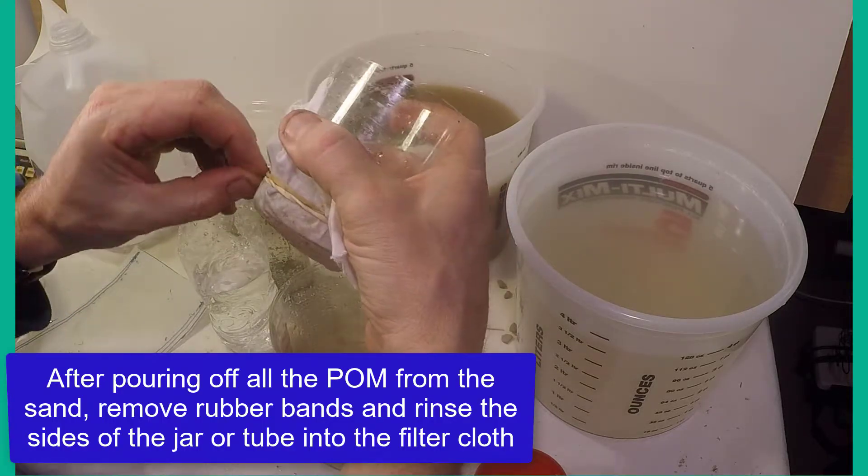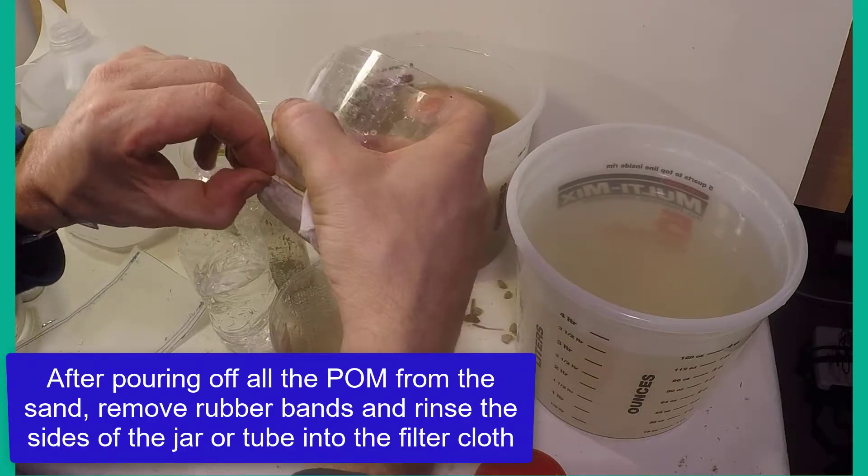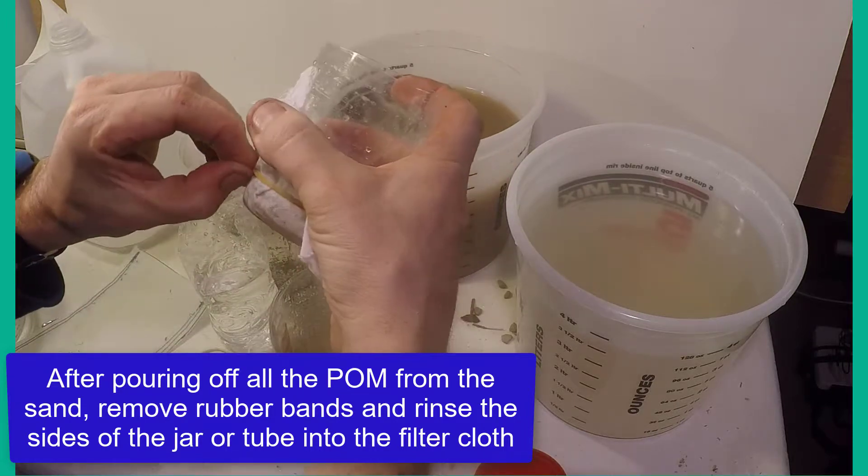Finally, detach the rubber bands of the cloth filter and wash any material on the sides of the filter onto the cloth.